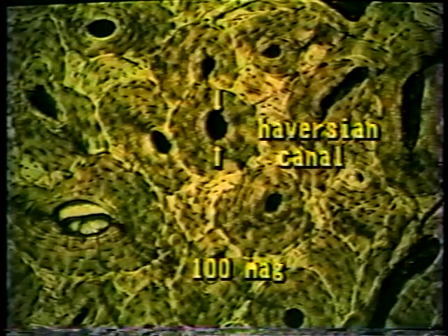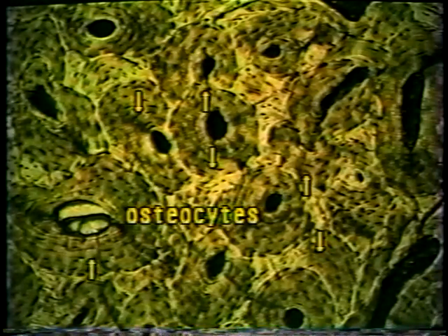There appear to be rings surrounding each Haversian canal, creating an appearance much like the annual rings in a tree. These rings are called concentric lamellae. They are actually layers of calcium salts separated by layers of bone cells. The bone cells, or osteocytes, look like black spots in the tissue. Actually, the black spots are spaces, or lacunae, in which the osteocytes are located. Osteocytes are responsible for producing the hard calcium matrix of bone.